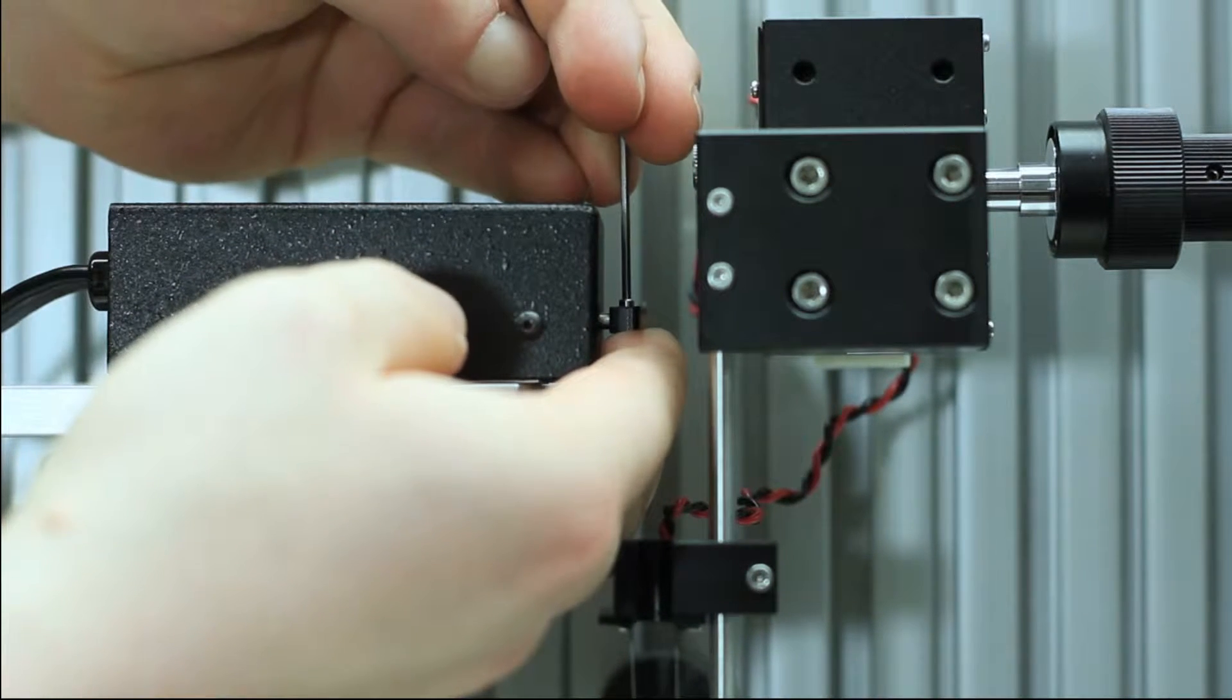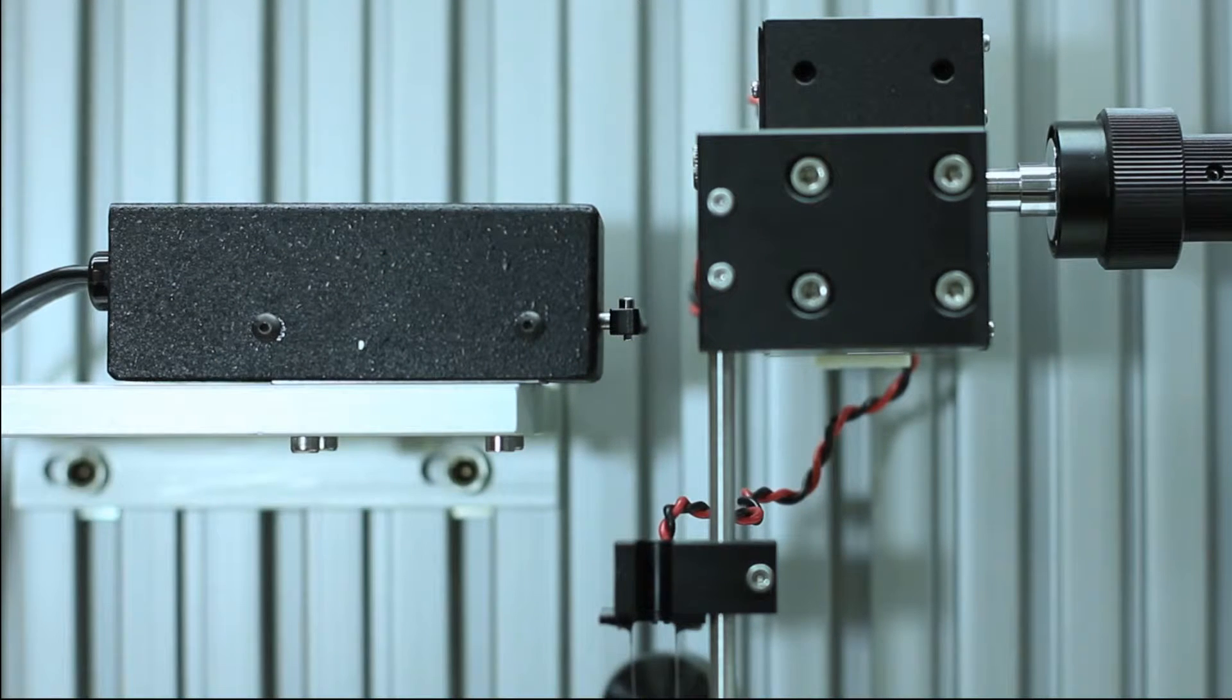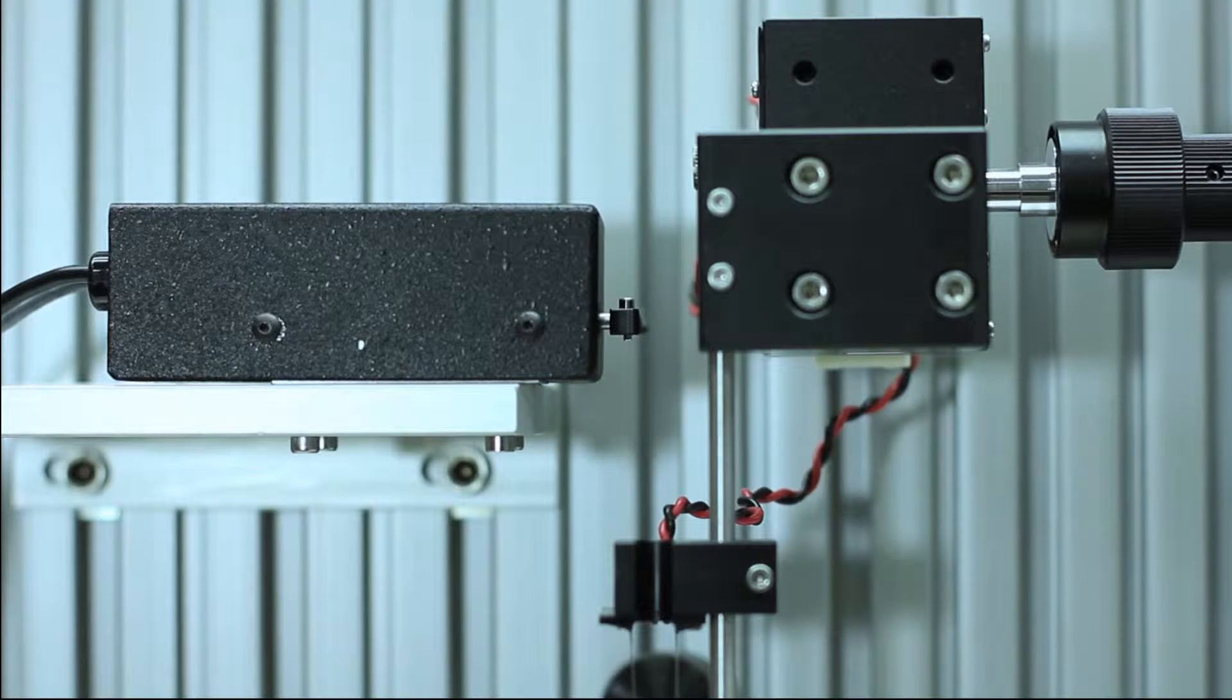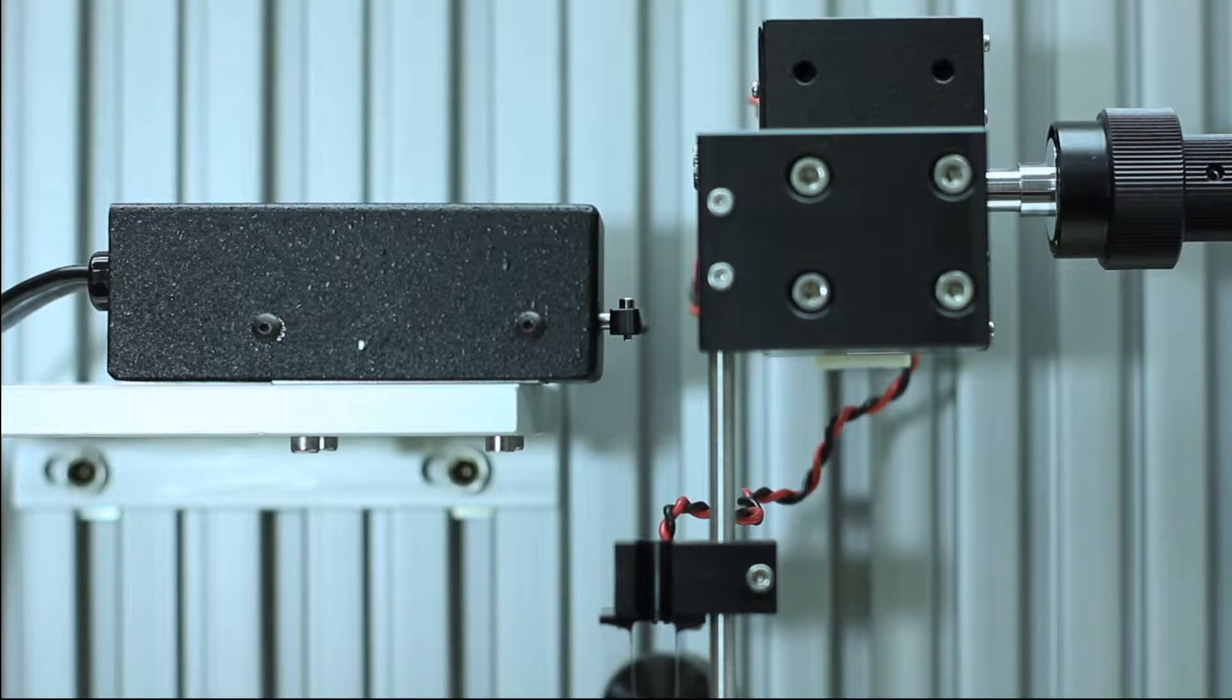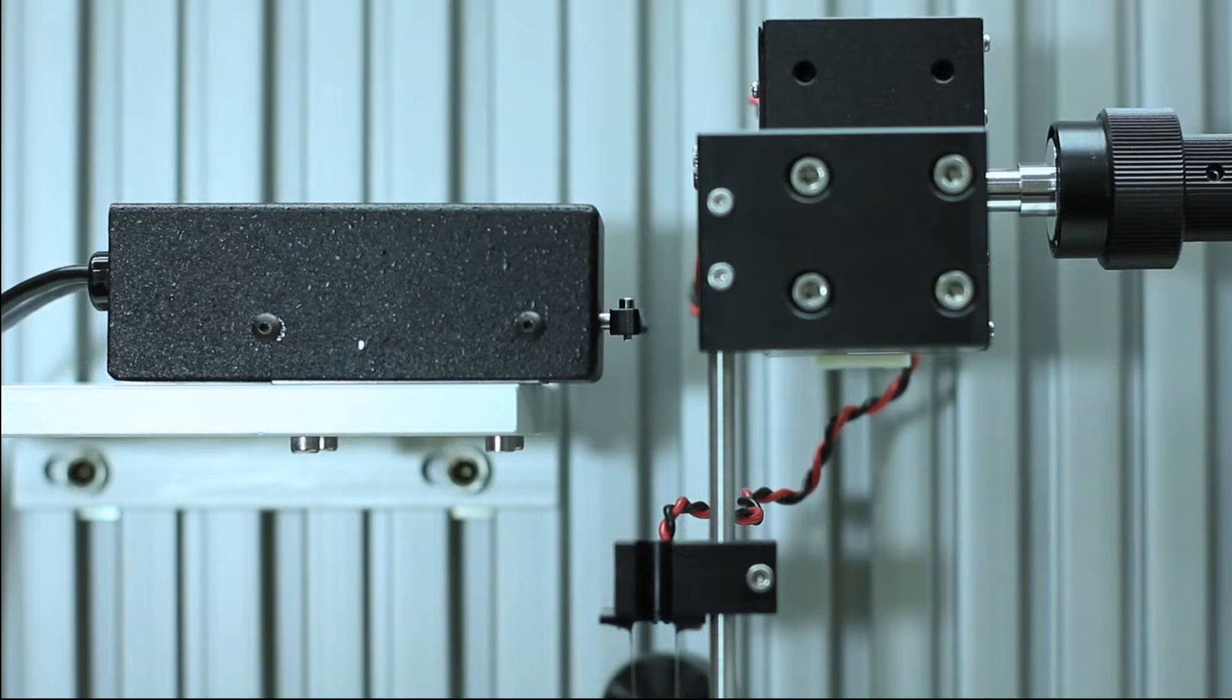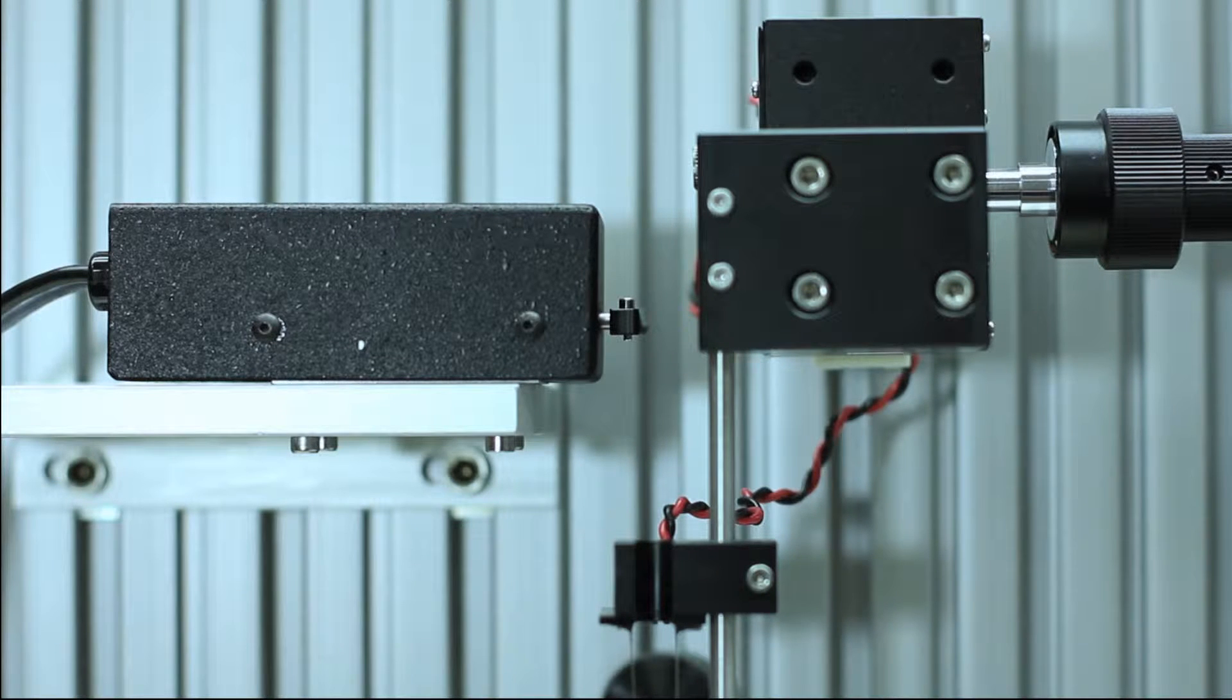Take your allen key and tighten the screw on the lever arm. The angle of the lever arm is arbitrary to the bath apparatus, but may require some adjustment.